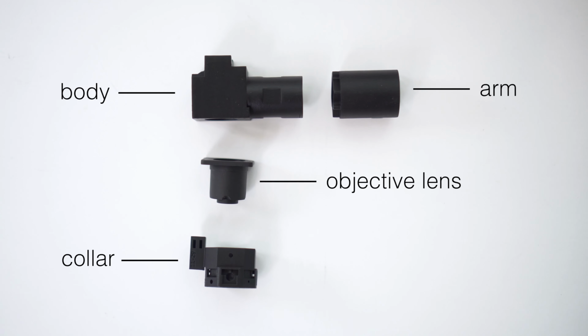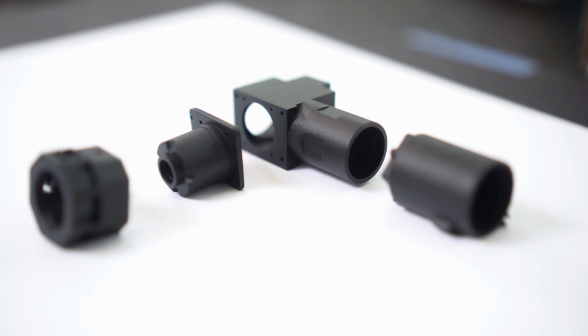In this video abstract from the December 5th issue of Neuron, we describe a new resource for wide-field calcium imaging in freely moving animals. We wanted a system that would allow researchers to record large-scale dynamics during natural behaviors like sleep, navigation, and social interactions. So we developed cScope, a head-mounted cortical macroscope light enough for a rat to carry.